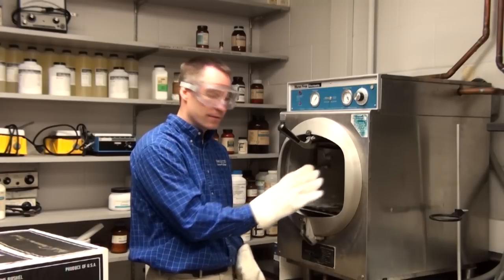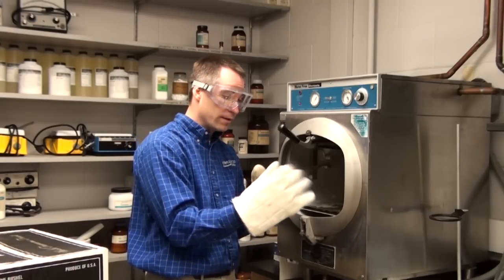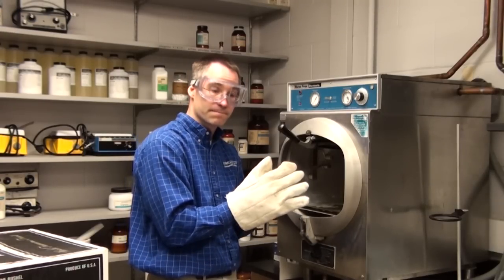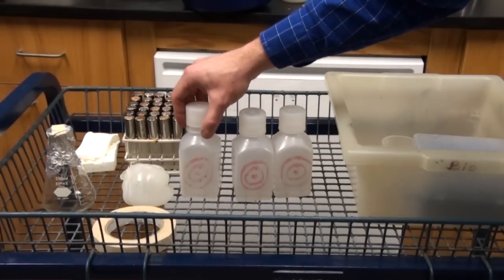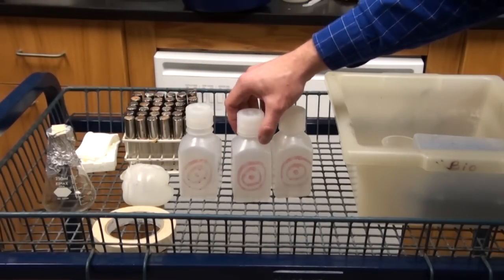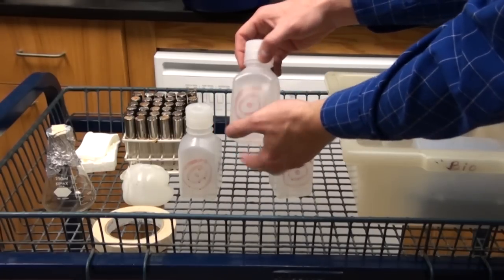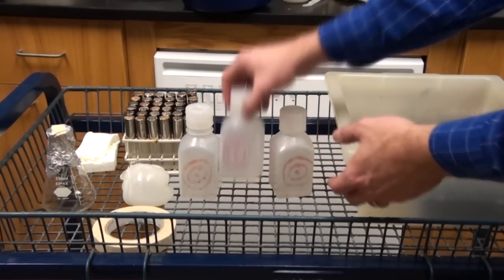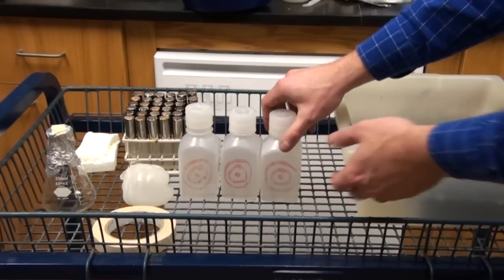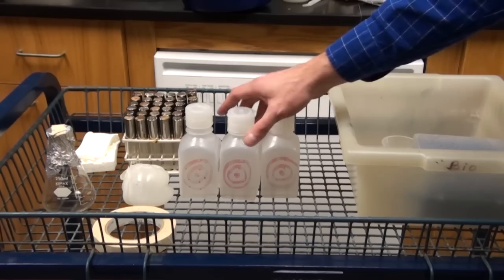This is still hot, so leave it available for the next person and be aware that as gloves get wet, they can no longer insulate against heat — avoid getting them wet. Here are my three bottles: one has a loose cap, one was capped inside the autoclave and since it couldn't equalize pressure it has bulged out a little — if that were a glass bottle it may have busted. The third was pulled out and I've now capped it. As these cool, we'll see the effect of the sealed caps.